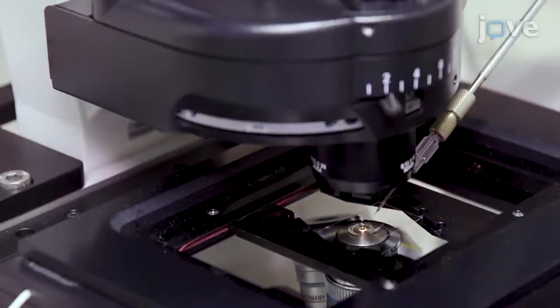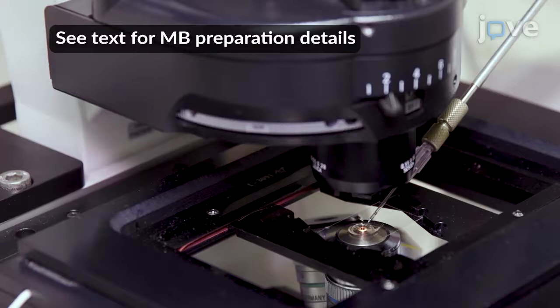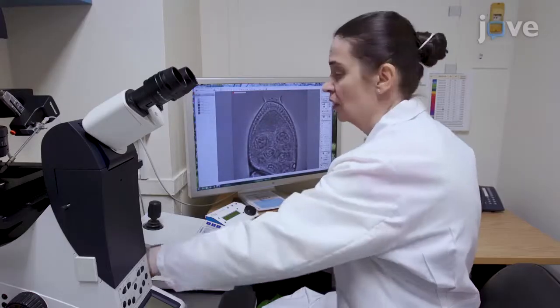Using the micromanipulator joystick, gently lower a needle loaded with 1 microliter of molecular beacon solution into the oil drop. Bring the tip into focus toward the periphery of the field of view. Perform a clean function to remove the air from the needle tip and to ensure that there is flow from the needle, and bring the needle to the home position.